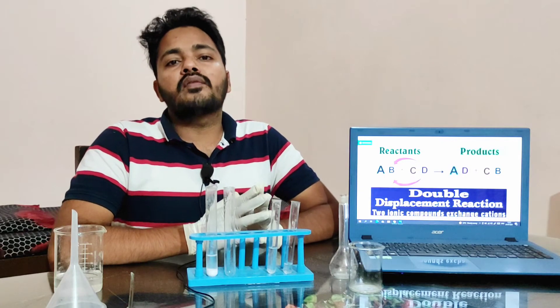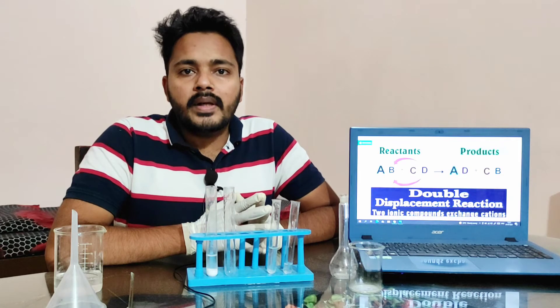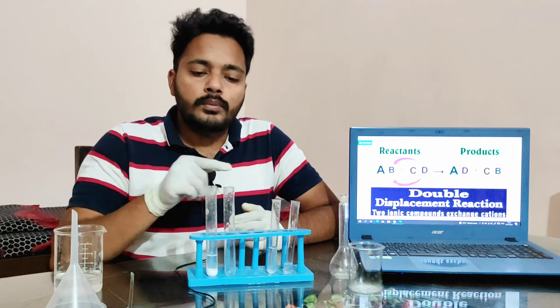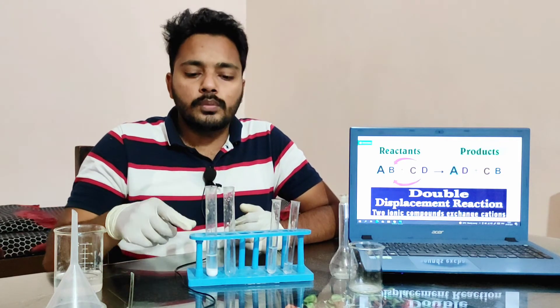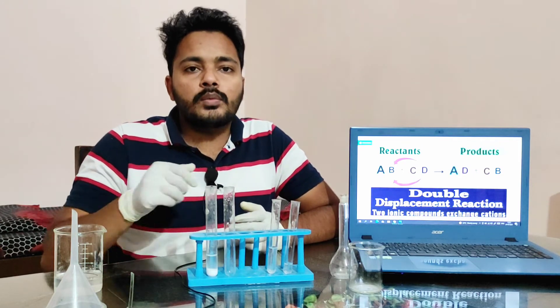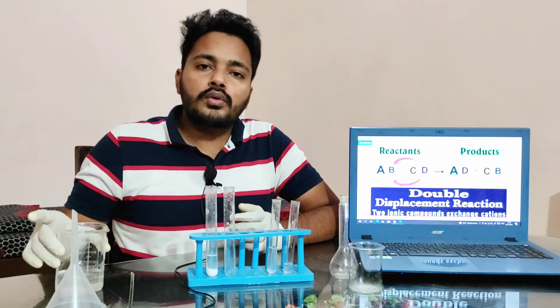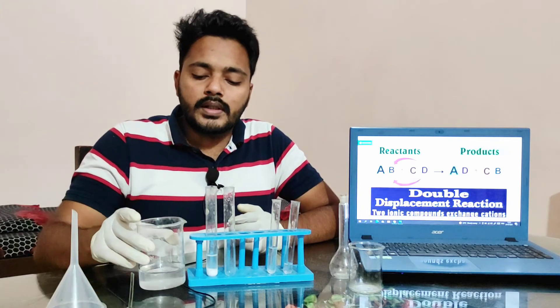Materials required for this experiment are a test tube, a boiling tube, a test tube holder, and some amount of water.